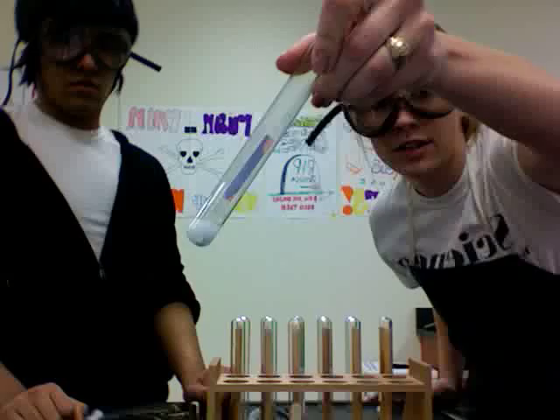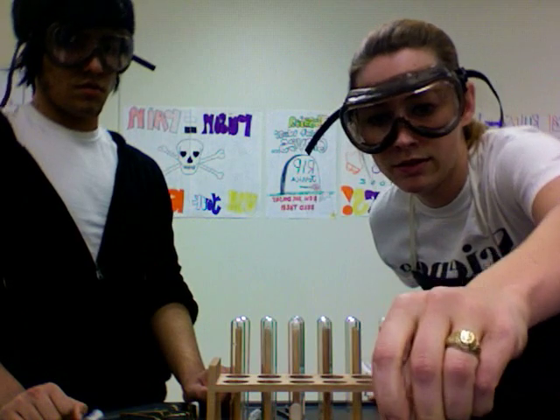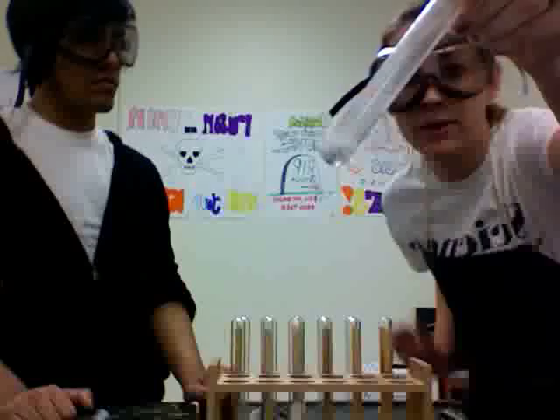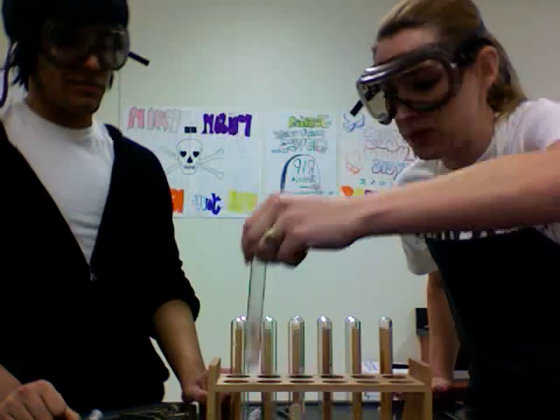And you can see it's turning from blue to red. Get it to go all the way down in there. So you can see that it's turning to red, so we're going to have to dispose of this in our waste disposal container later.